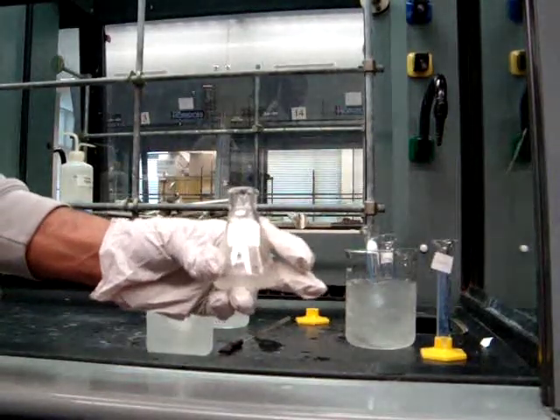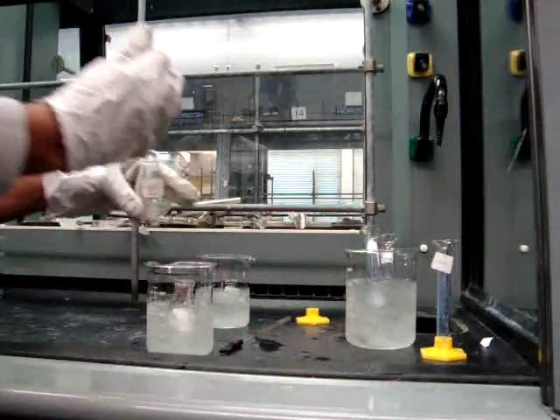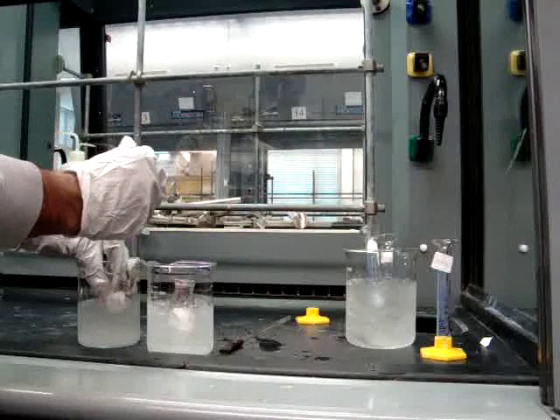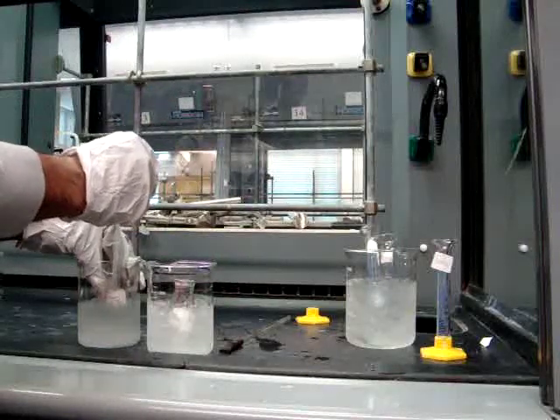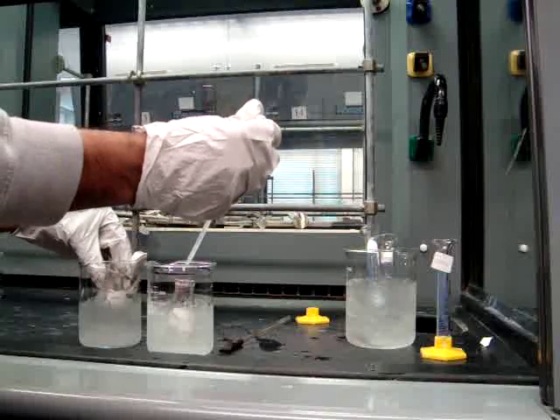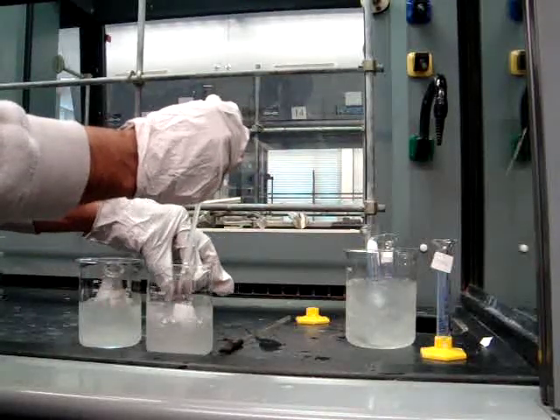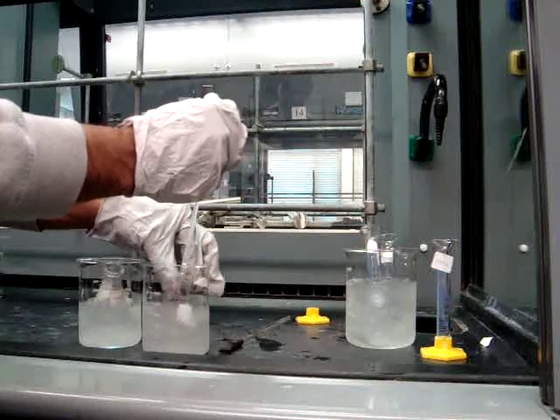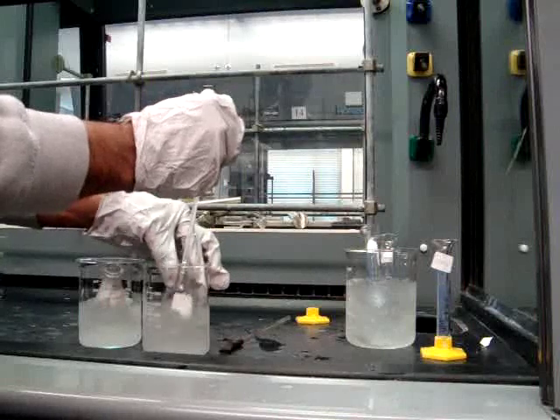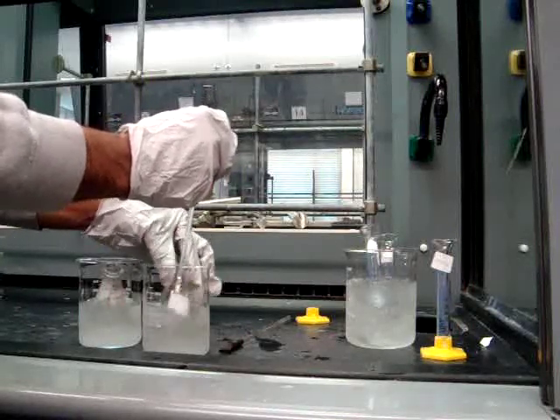Now you'll need to add the mixture of nitric acid and sulfuric acid that has been cooling. You'll need to add this solution dropwise into your reaction flask, remembering to keep the temperature always below 0 degrees Celsius and adding it over a period of 10 minutes. You want to make sure that you don't exceed a period of 15 minutes, since the sulfuric acid nitric acid mixture isn't terribly stable.